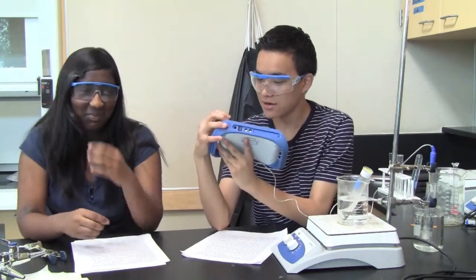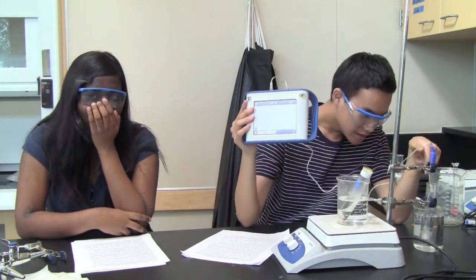Because that will ruin your data. So, now you can just start the data table. Start, and then it's going right now. As you can see, the liquid is going to be turning into a solid already because it's meeting its freezing point. And we're just going to determine that once we get to the post-lab, which is later. So now we just wait.